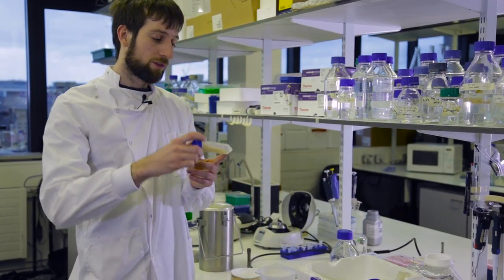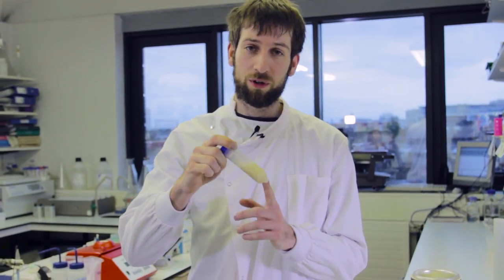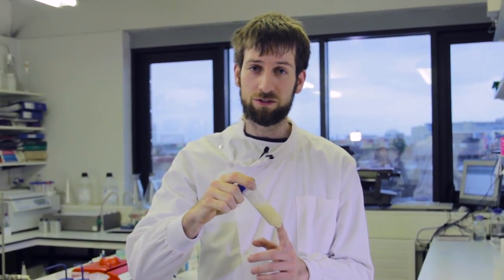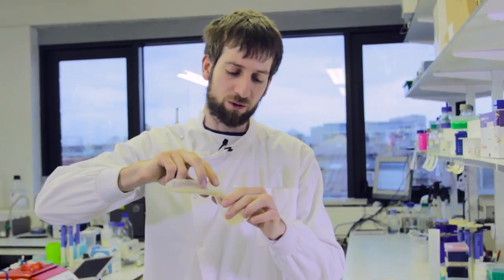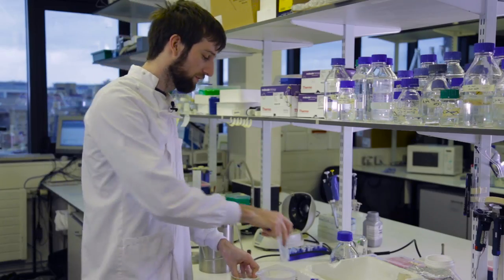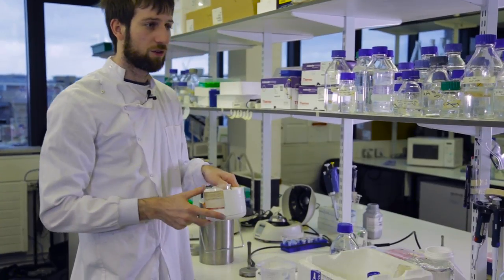Our cells have thawed out after being frozen in liquid nitrogen. We need to further lyse the cells by using sonication. We do this in a glass beaker to ensure that the heat created by sonication is properly distributed and our proteins don't get degraded by the heat. So I'm going to put the glass beaker into a beaker of ice and we'll take it to the sonicating probe.